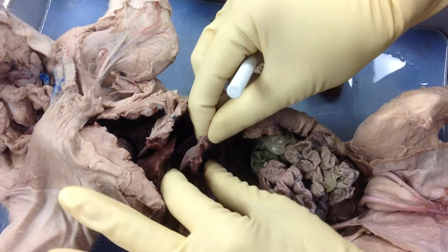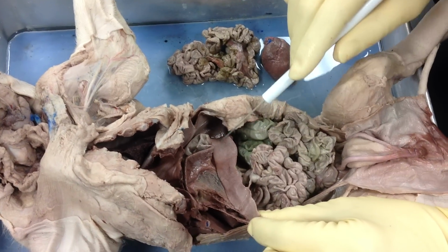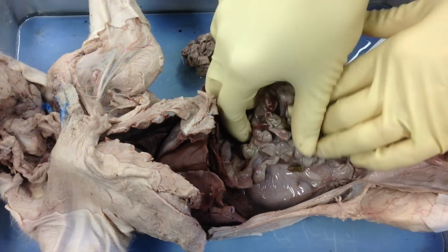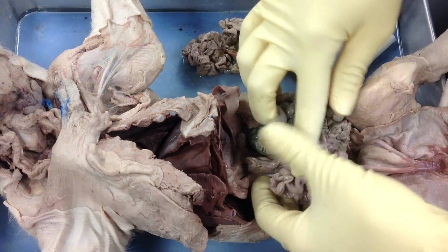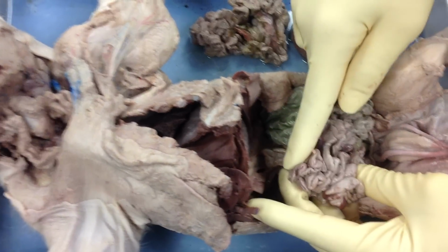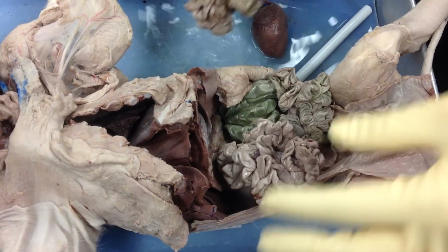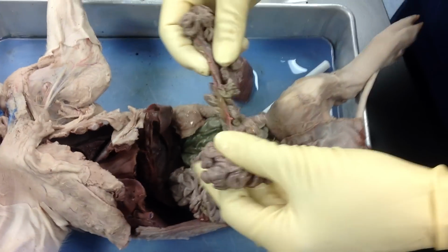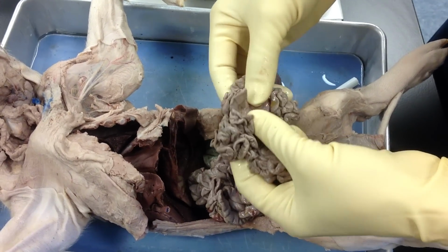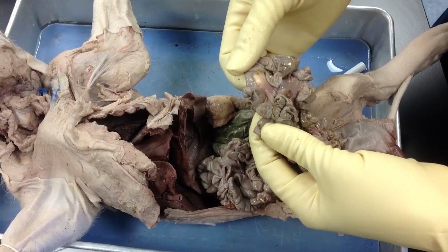And then we have, I like to say, a finger-like projection off the side of the stomach, and this is our spleen. Now as we move down into the small intestine, of course, we pass the pyloric sphincter, and then the first set of structures that we're going to see is the intertwining mesentery of the small intestine. So I've got a small intestine here dissected out. And the mesentery, of course, is the setup of these veins that are running through the small intestine. That's called mesentery, okay?